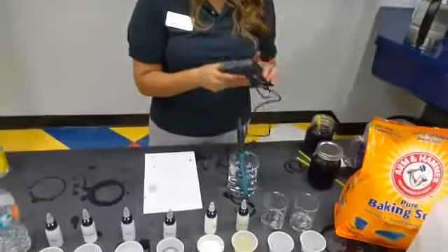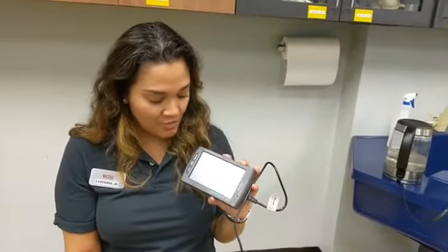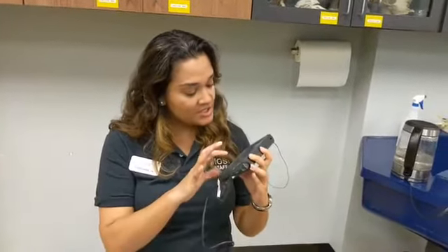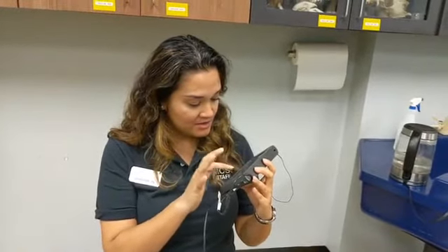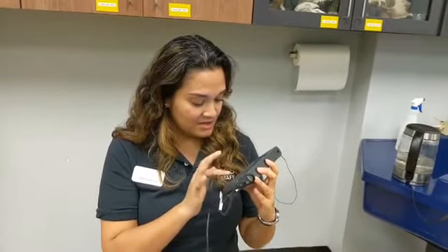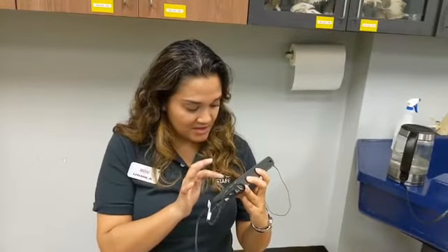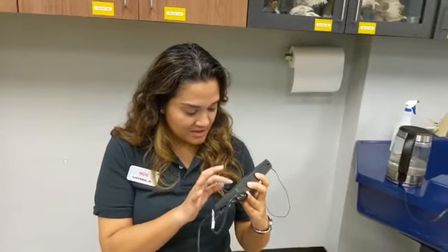And we're using a pH meter right here. So I have some water that was a 7. We're gonna zero that in. All right, so that way we start off with... there we go.